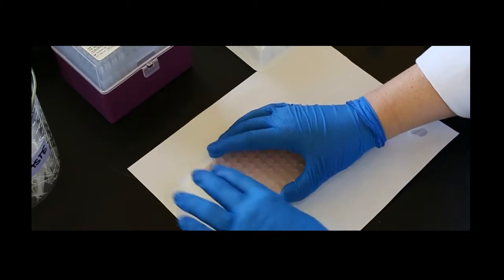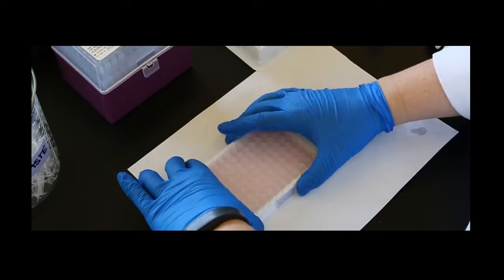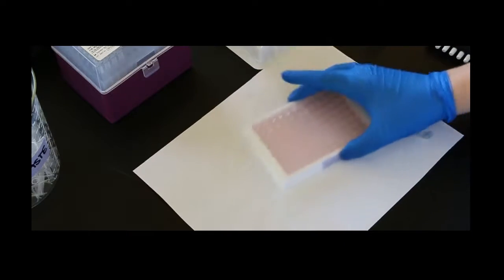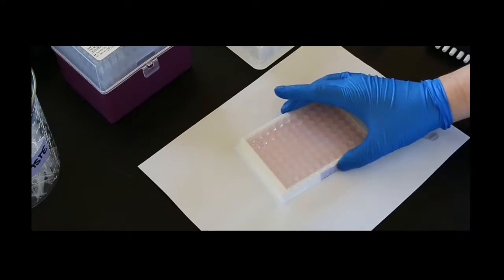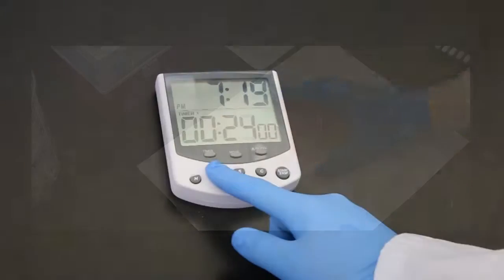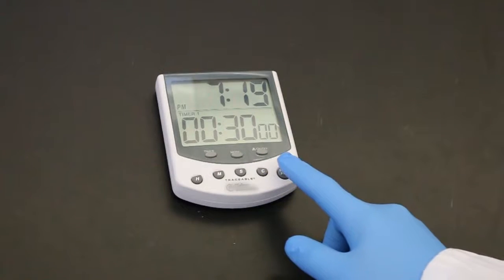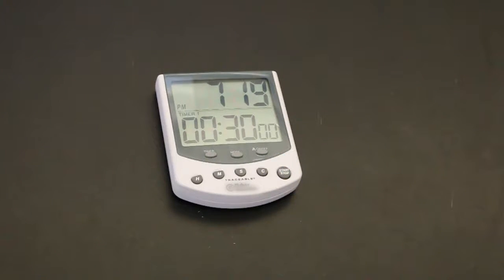The wells are again covered with parafilm or tape and mixed by moving the plate in a circular motion on the benchtop for 30 seconds. The plate is incubated at room temperature for 20 to 30 minutes.